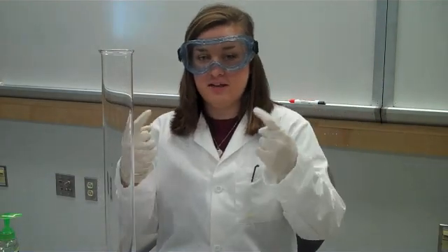Alright, so this is one of our experiments that is toxic. So, without safety gloves, safety lab coat, and safety goggles, and the supervision of a trained professional, this experiment should not be done.